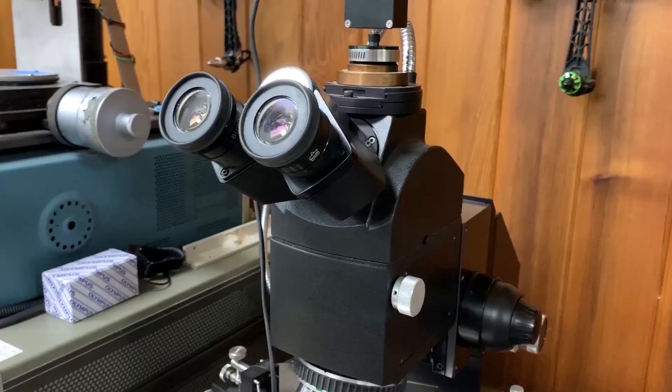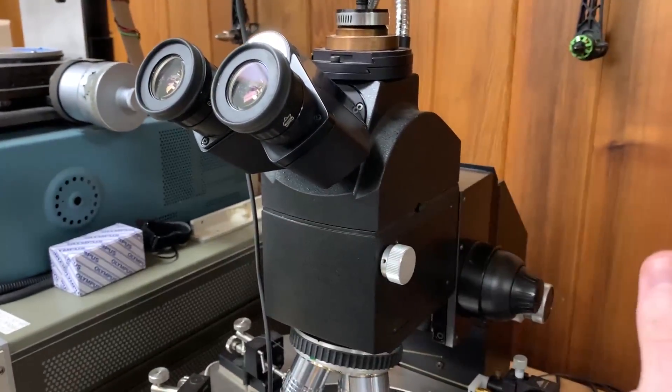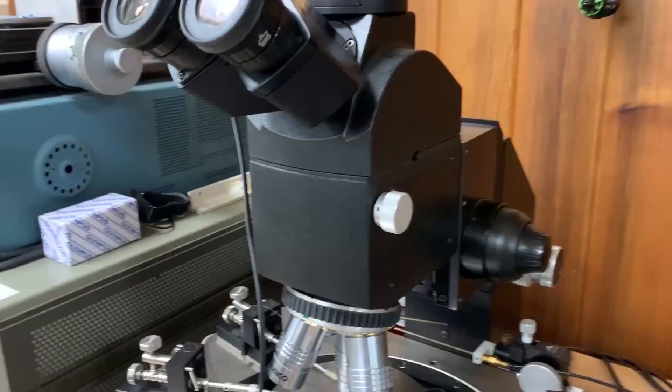It's good for these kind of measurements. A wider band is of course a lot better because you can get more measurements across that band and kind of average it.